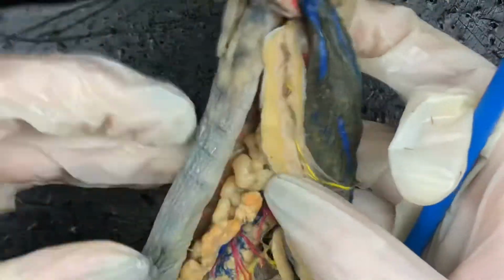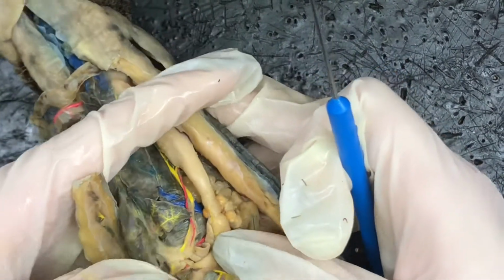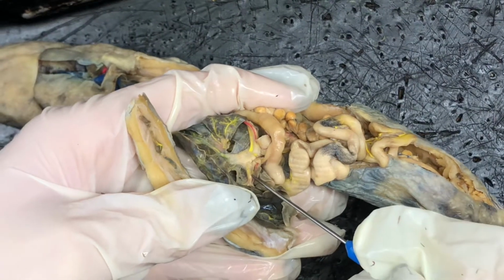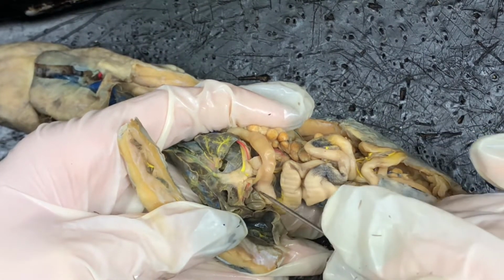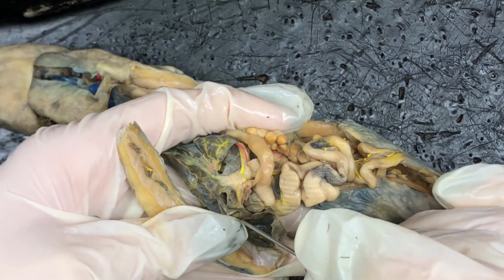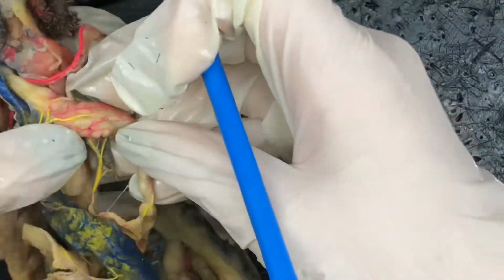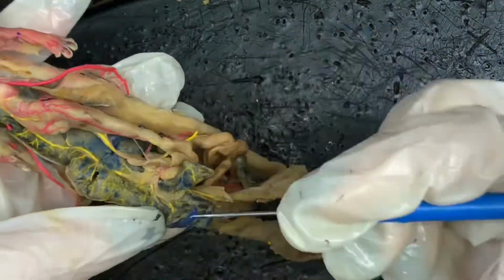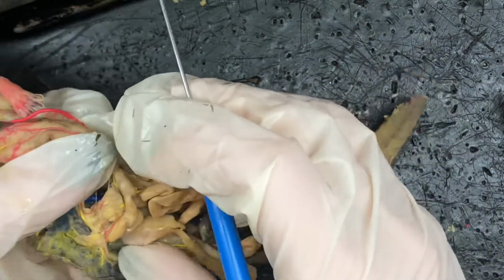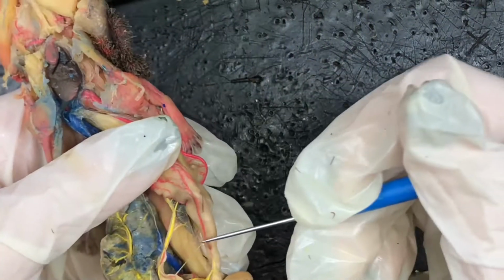We have the hepatoduodenal artery. So we're going to look here in the liver. The hepatoduodenal artery is right here. It's very faint. But you can tell from the name, hepato is liver and duodenal is the duodenum. So the hepatoduodenal artery is right here. And then our pancreaticoduodenal artery is going to be running right along here. We can actually see that better in this Necturus. So orient ourselves again. Here's the liver. Our hepatoduodenal artery would be running right about here, and then our pancreaticoduodenal artery is right about here.